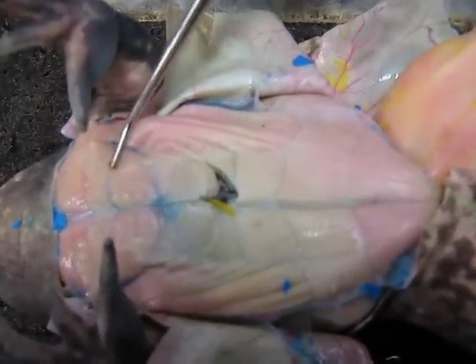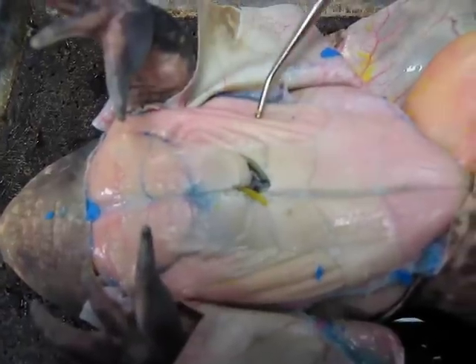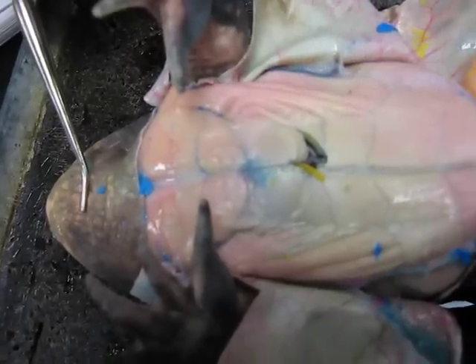And up around it, the abs, is the pectoralis. And this muscle right here, under this flap of skin, is the mylohyoid.